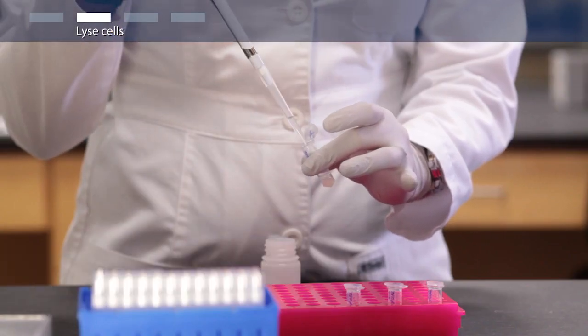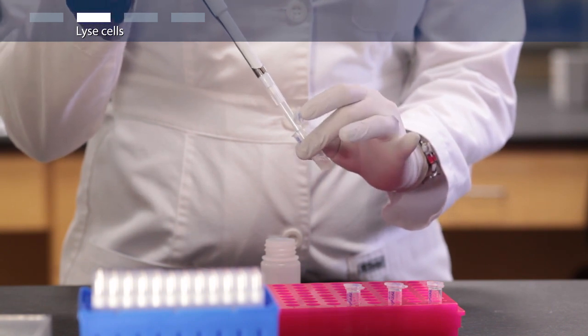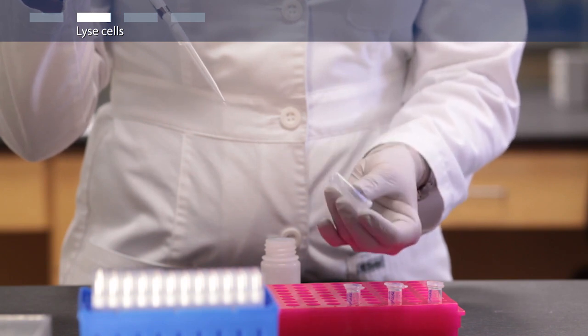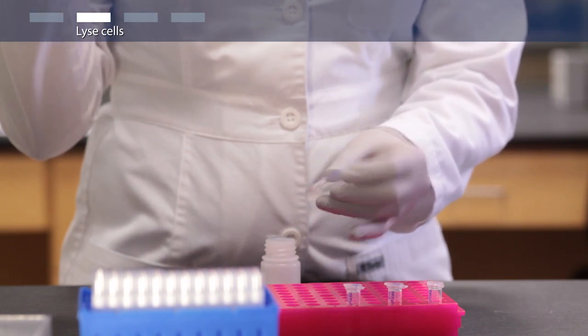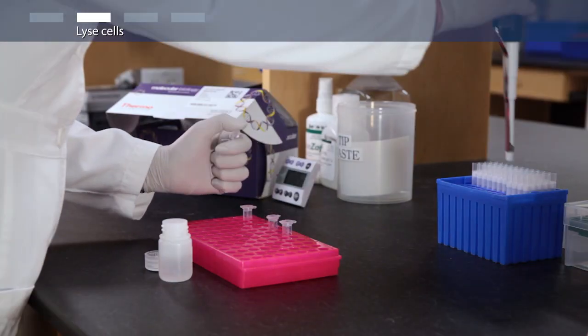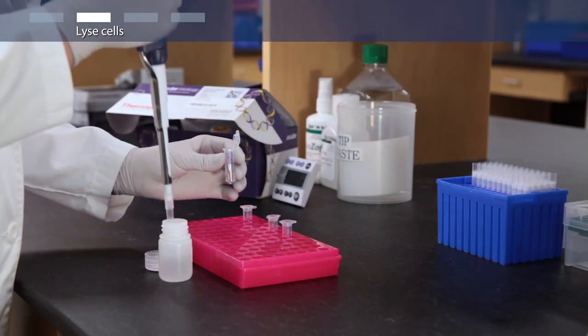Next, add 250 microliters of lysis solution and mix thoroughly by inverting four to six times. The solution will become viscous. The sample can be incubated for up to five minutes at room temperature.